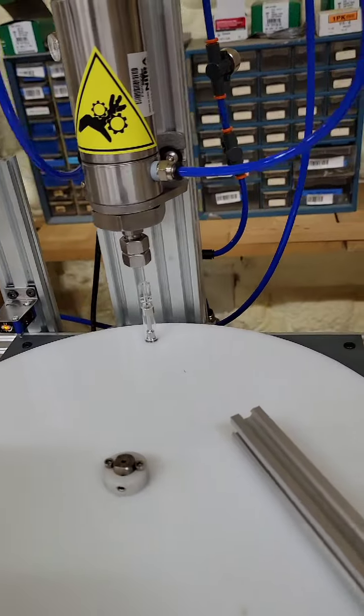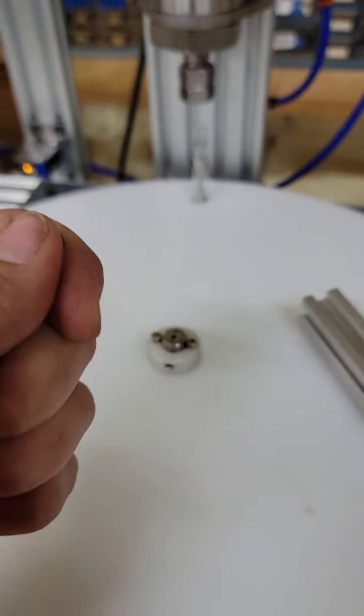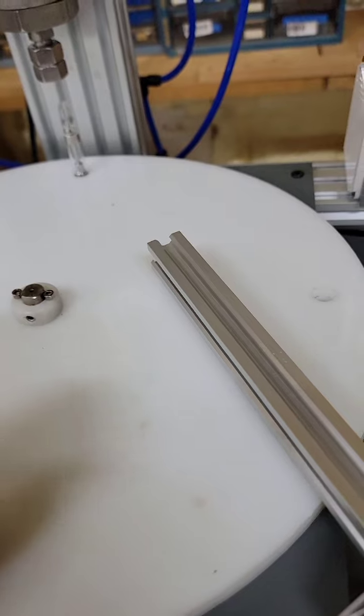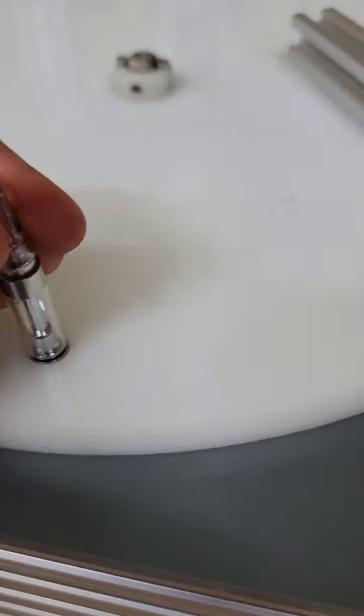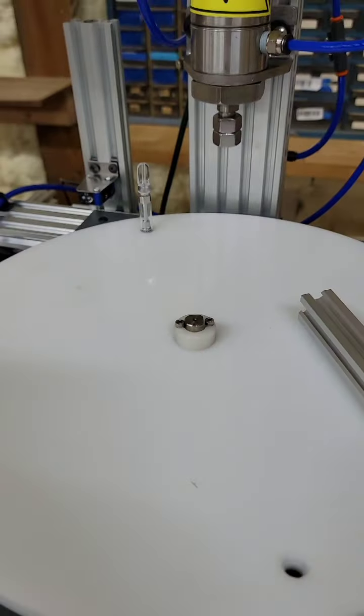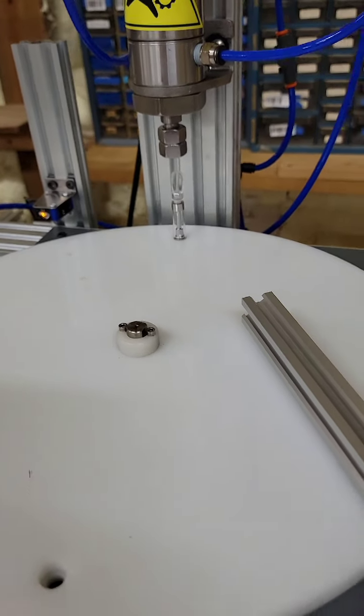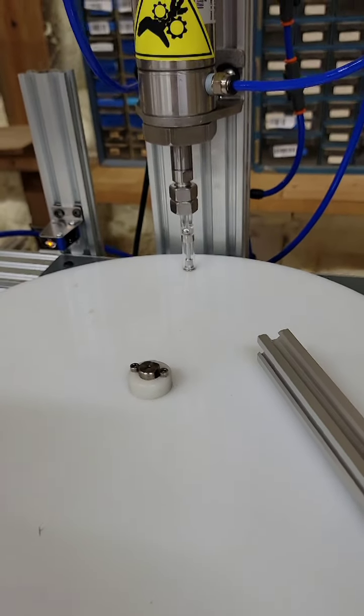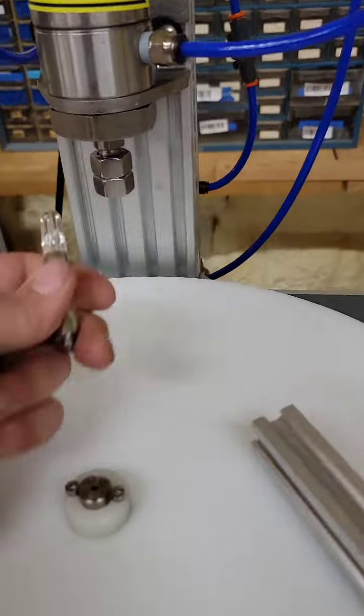And just to leave it on capping, here's basically one you'd throw it in, cap it, or just put your cap on, hit it. That one would have stopped because I didn't have one in the middle. But that one wouldn't eject. And there you go.